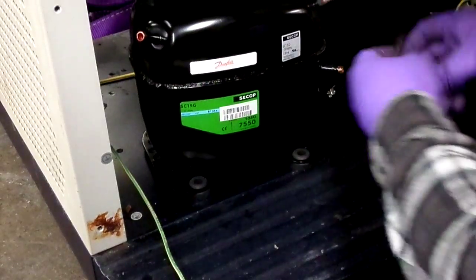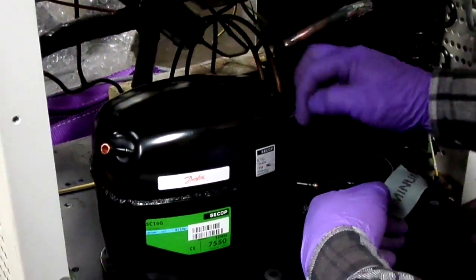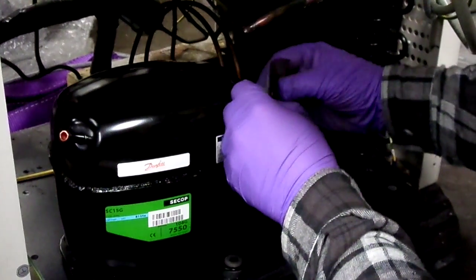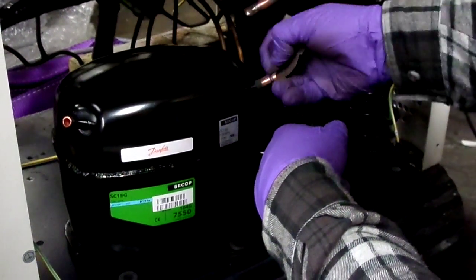by just going far enough over it so you're getting your contact here. But I like to get as much of it out as possible. Okay, emery cloth. Just keep turning.